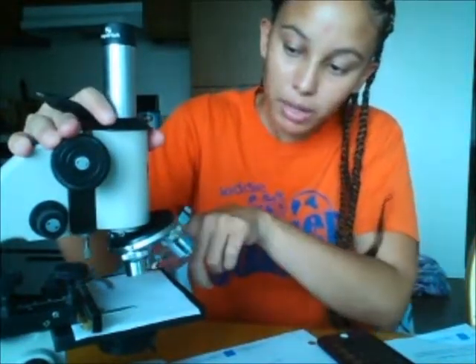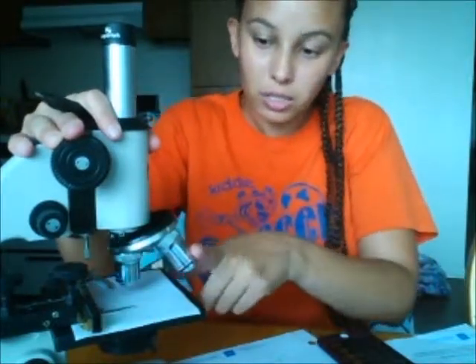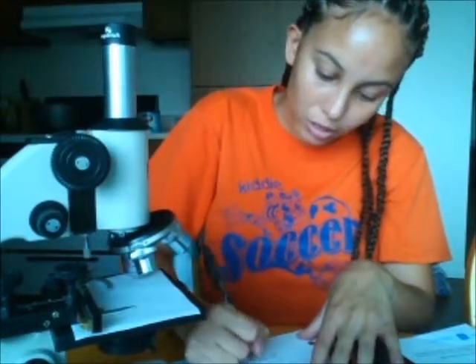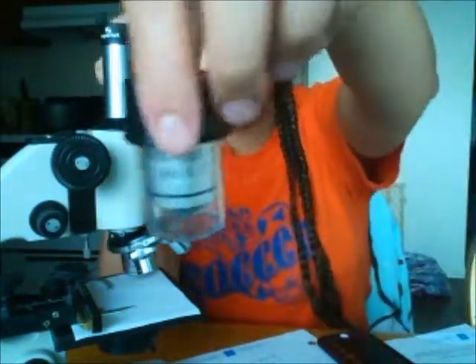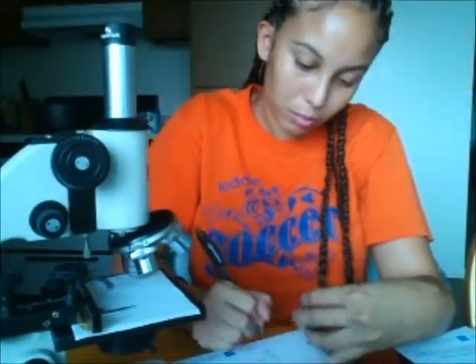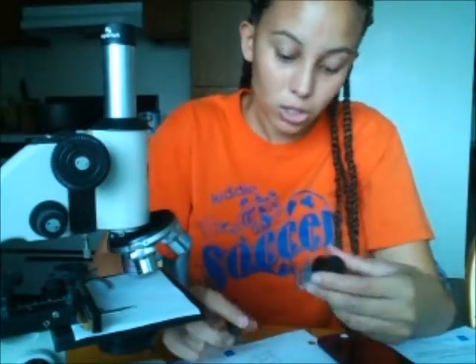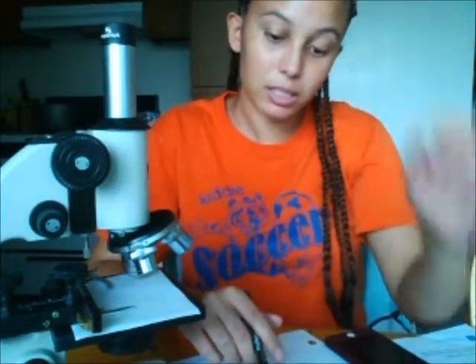The second to last one would be my high lens, which is the longer lens here. It is colored in red. That is 40, so I would multiply that by the ocular magnification, which is 15. Then we have a fourth lens here, which is our oil immersion. That one is actually a magnification of 100, and we would multiply that by 15 because of our ocular lens. So to find the total magnification, you just take the ocular lens magnification and the objective lens magnification, multiply them, and you come up with your total magnification.